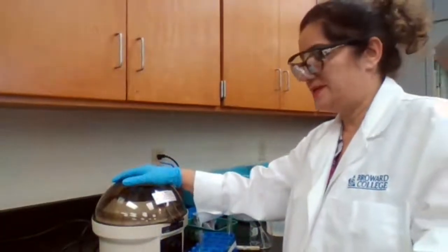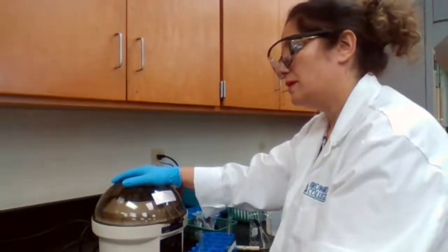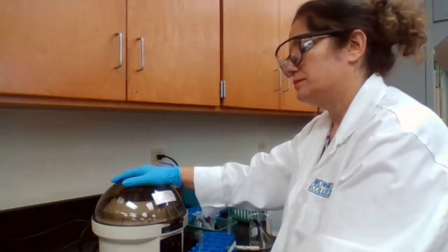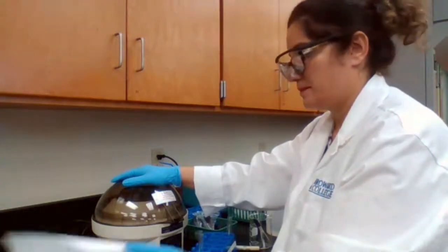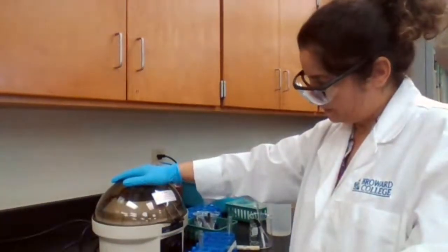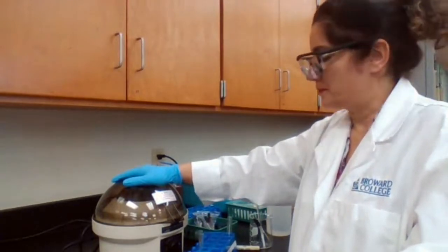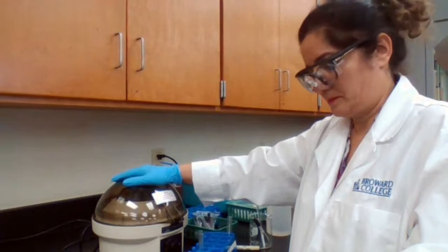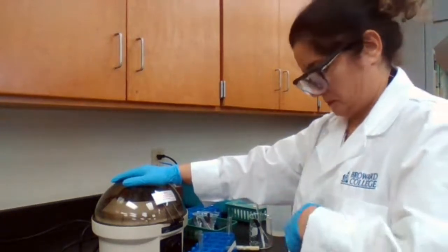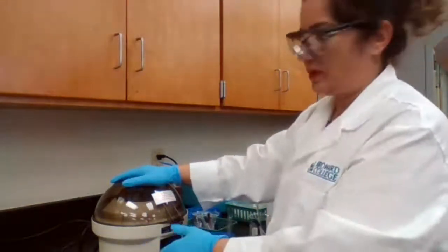You centrifuge for about 30 seconds to 1 minute.